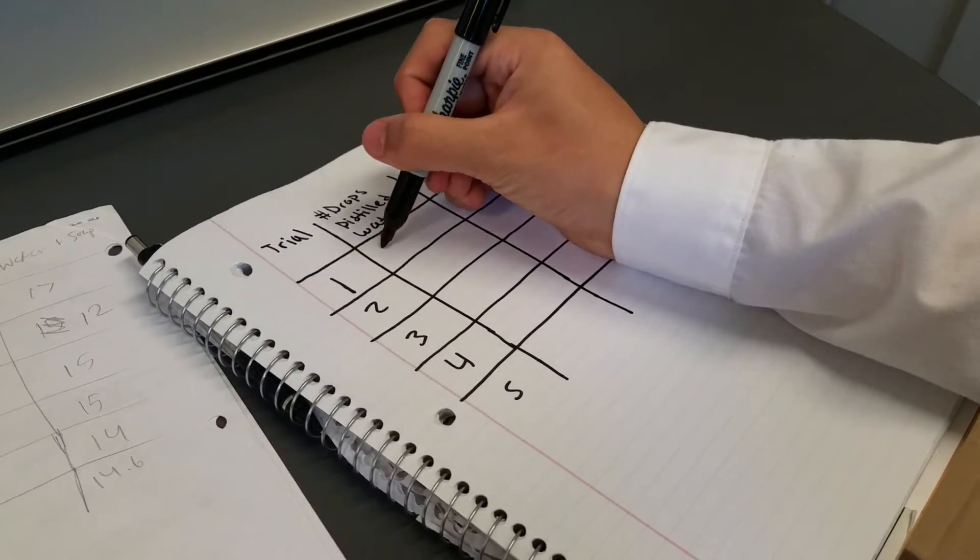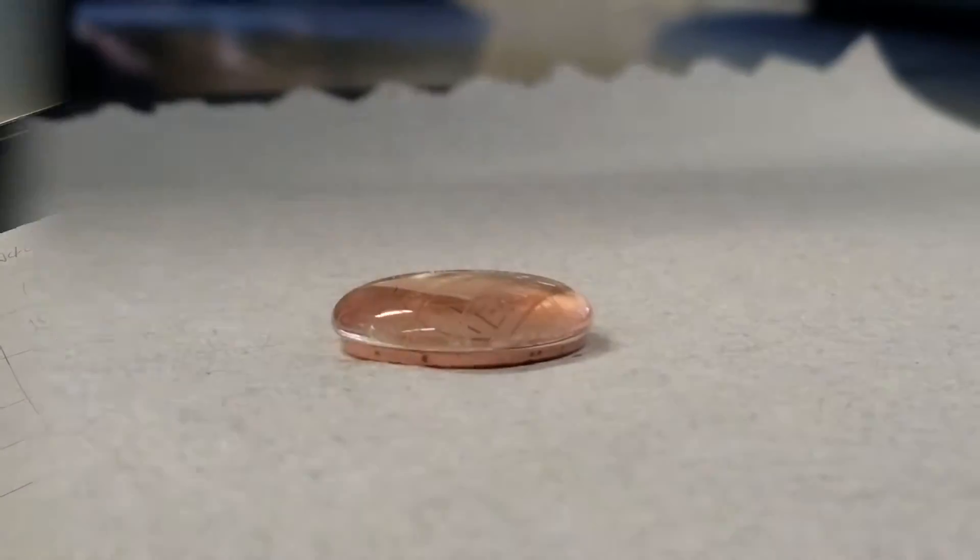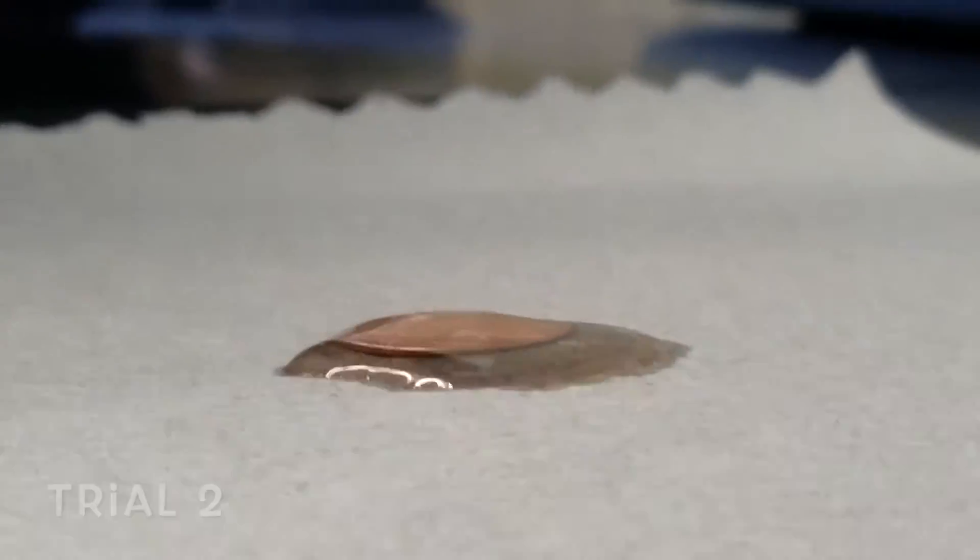Be sure to record the number of drops for each trial. You're going to be repeating these steps for five trials.